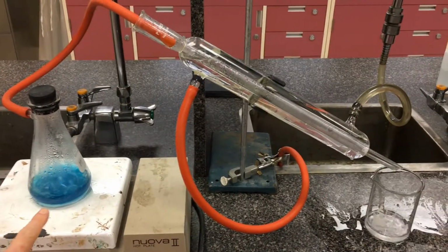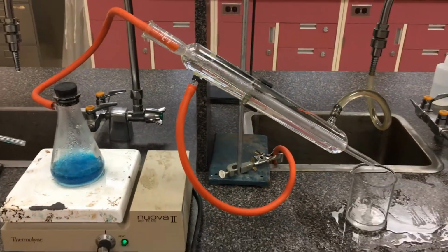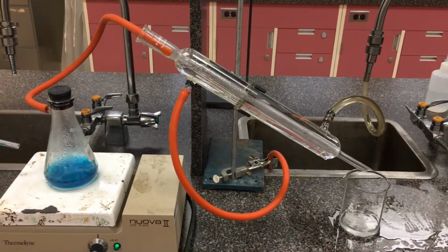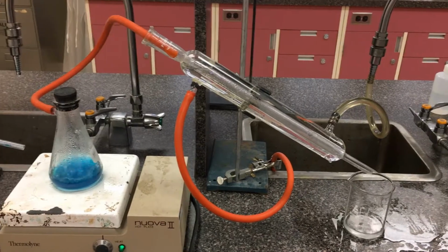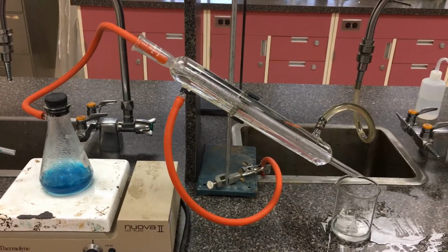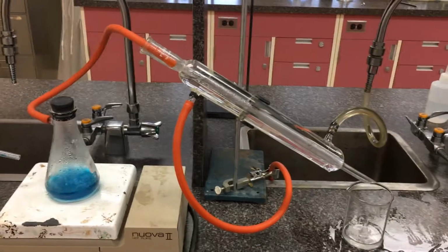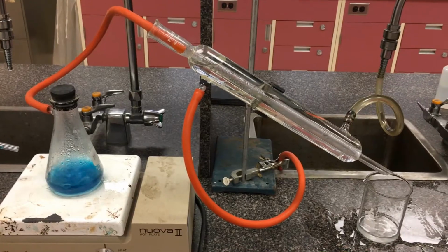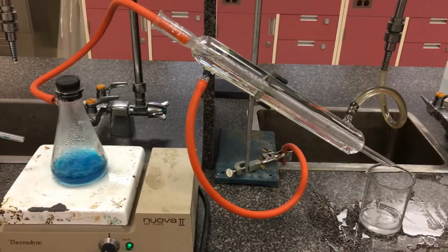Let's imagine that I have a primary alcohol in here, which would be an alkane having that OH functionality. The carbon here would be terminal, so it's only holding maybe 0 carbons, but at maximum 1 carbon. Because it is a primary alcohol here, you would throw an oxidizing agent inside, so add in some acidified dichromate here. The heat comes from this hot plate here.